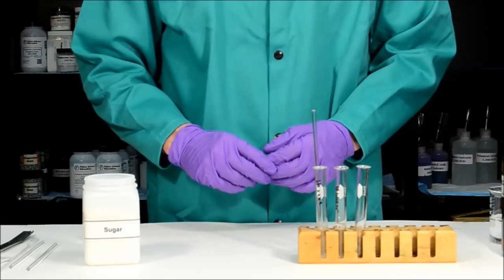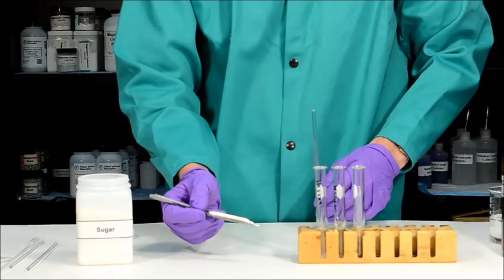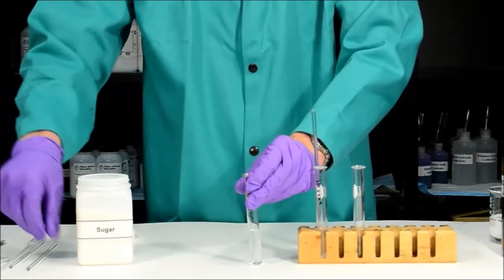Next, we'll test if sugar is soluble in water. I'll get a small amount of sugar and add it to the water test tube, then insert a glass stirring rod and gently swirl the solution. Of course, we all know sugar is soluble in water — because sugar is a polar solute and water is a polar solvent, they are alike and the sugar is able to dissolve.